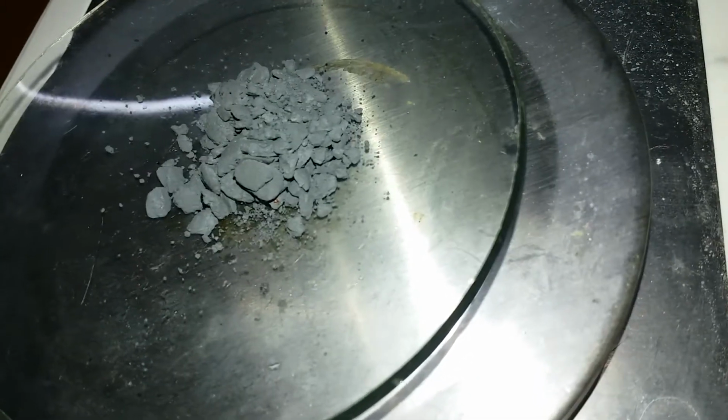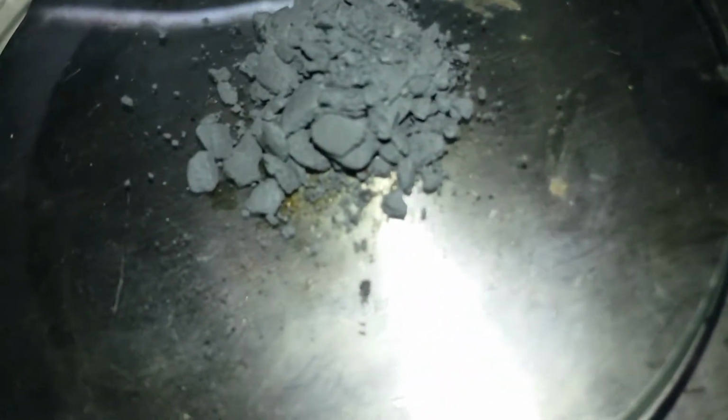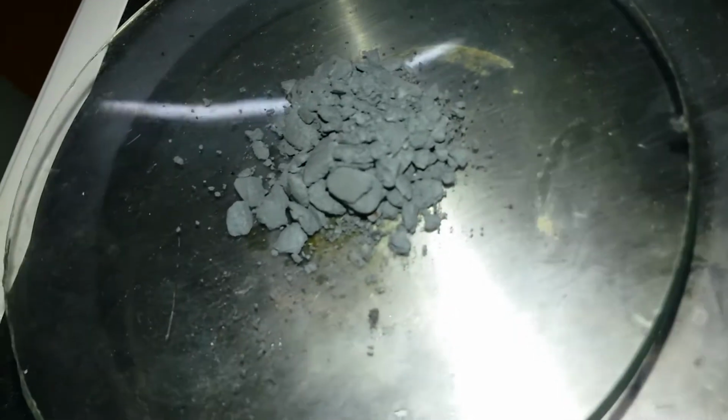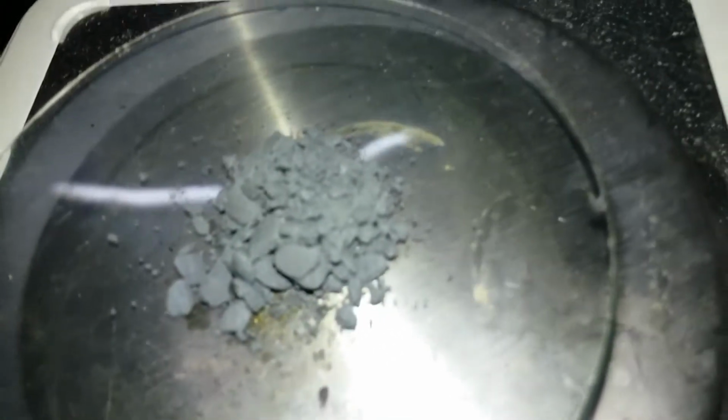Wow. Theoretically I should get around 5 grams, but looking at this, 7 grams. Okay, let's say I got 6 grams. Okay, maybe 5 grams is perfect. 5 grams dry sample. Okay, I would say 2 grams is water, and we have more in here. So, well, wow.